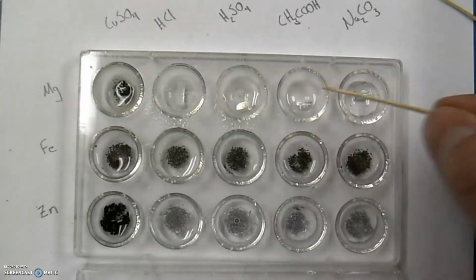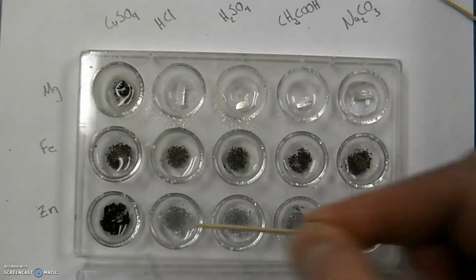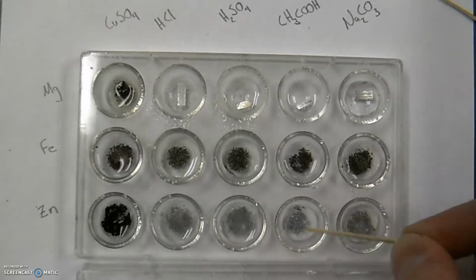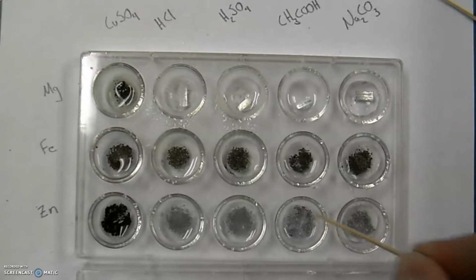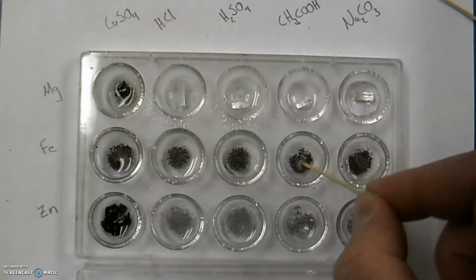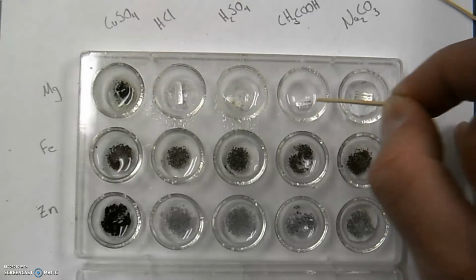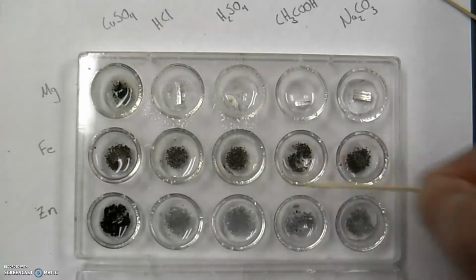Obviously, I'm very much seeing over here. These guys, upon first glimpse, like this one, I clearly see something going on. Bubbles. I see bubbles. Hang on here. This one, I'm not really seeing the bubbles as well, but if you were to sit here long enough, you would see enough significant bubbles. And I would say the same thing going on here. And even here. This one you can see the bubbles forming there. But the other ones are a little more blah. I don't see them as quickly. The other ones are more significant.